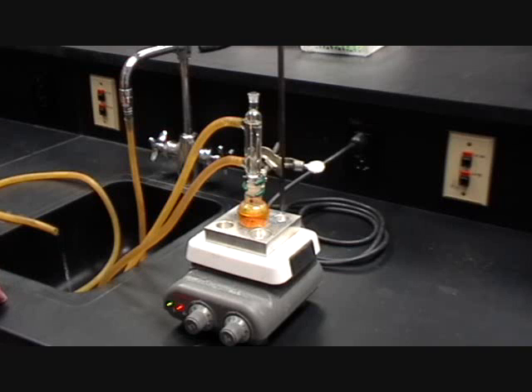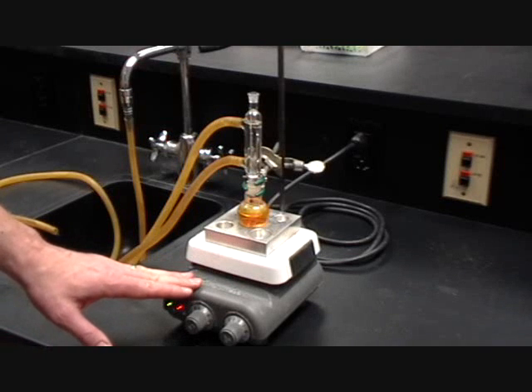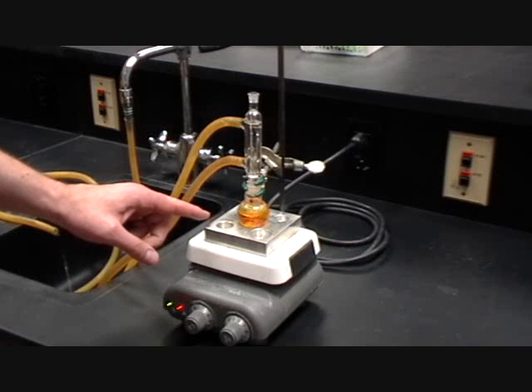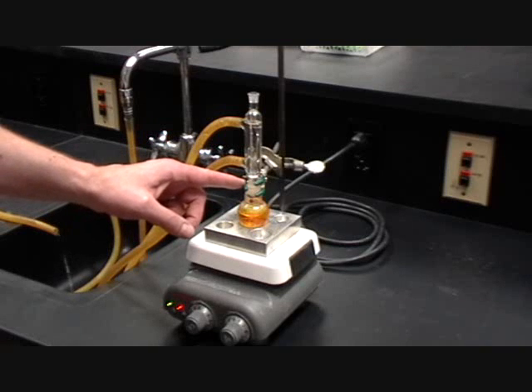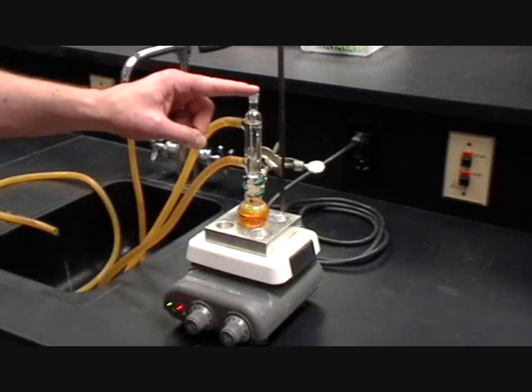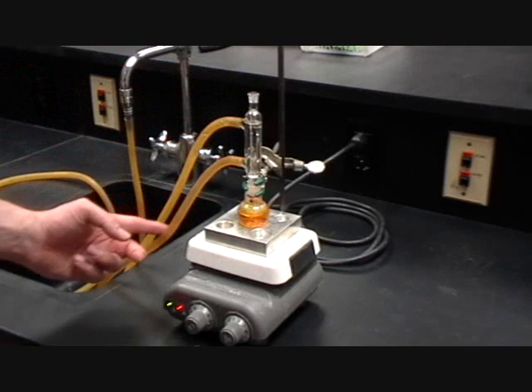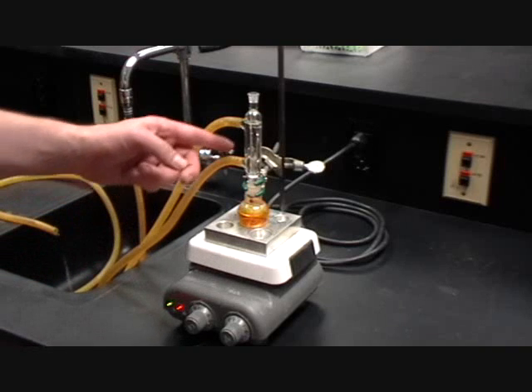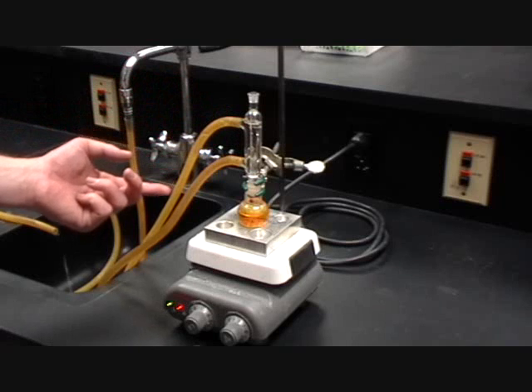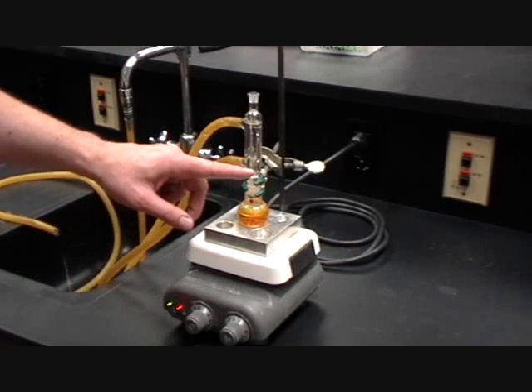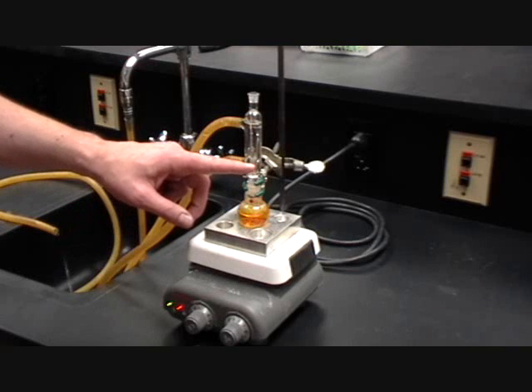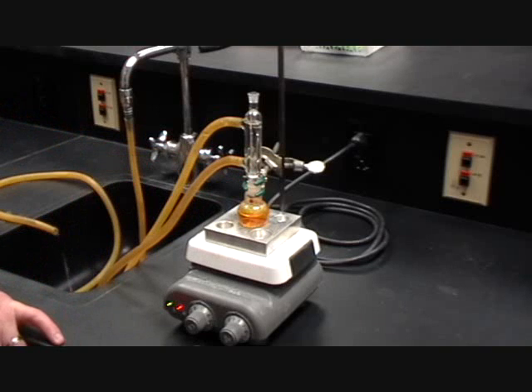So, for the first part of the experiment, you'll have your hot plate, your aluminium block on top, the round bottom flask rests on top of the aluminium block. You'll then clamp the round bottom flask at the neck, put your condenser on top, and connect the bottom line to the water coming in, so the water comes in, rises up, and then leaves by the top aperture. And once the mixture starts to reflux, once it gets to the boiling temperature, which you'll see with signs of vapours in the condenser as the liquid reforms, you'll be able to start your clock and let the reaction reflux for at least 30 minutes.